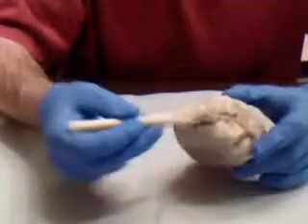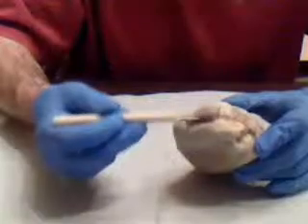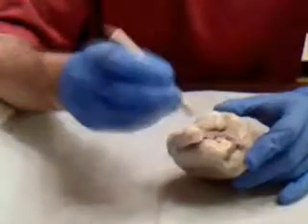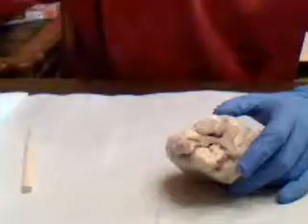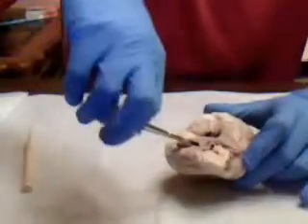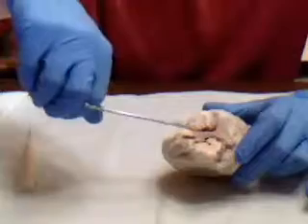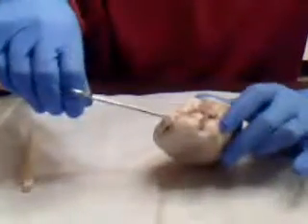At the top right over here, this is called the pulmonary trunk, and the pulmonary trunk carries deoxygenated blood from the heart to the lungs. Now the aorta is right here. This is where the aorta would be, in this big hole. And the aorta distributes oxygenated blood to all the parts of the body, so it would come out of here and be able to spread blood to the entire body.